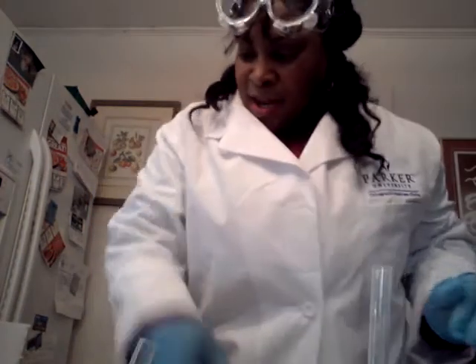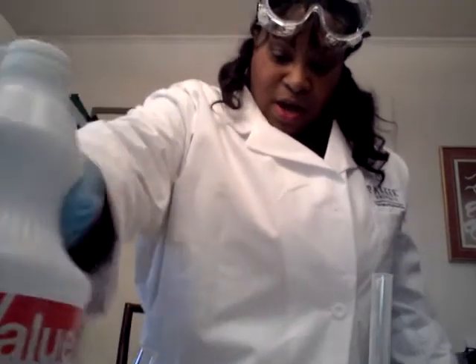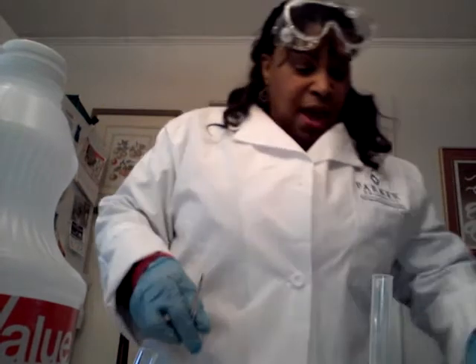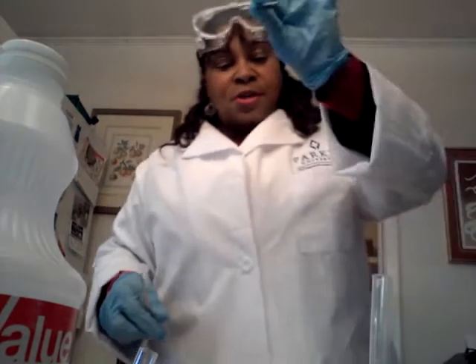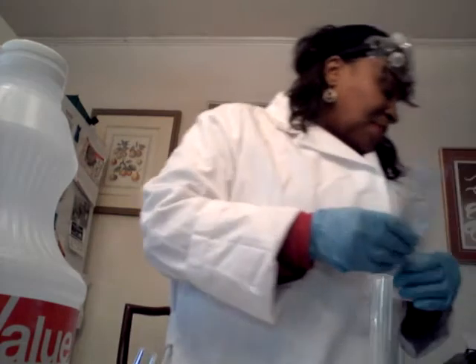We have our strip paper, and we have our distilled water here, along with the scissors that were required, and the white paper, which is right here, and toothpicks, of course, and all of these supplies. Today we're supposed to be doing the testing on the buffering.